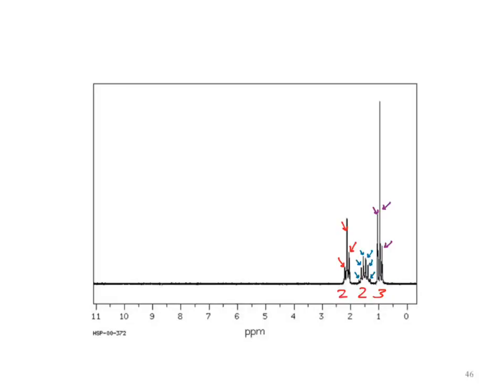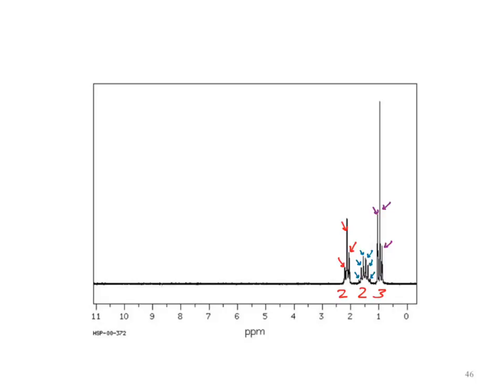Let's go ahead and start our analysis. We have three signals, which means three unique hydrogens.